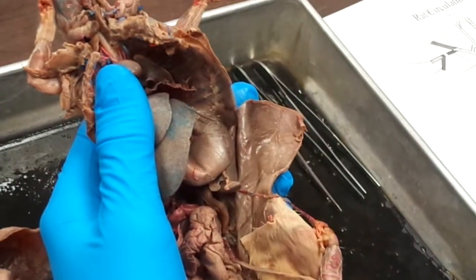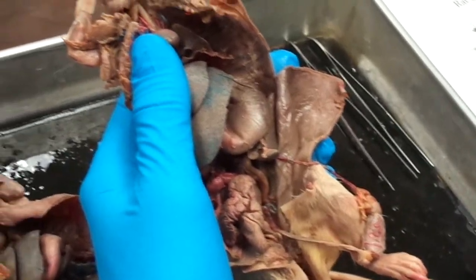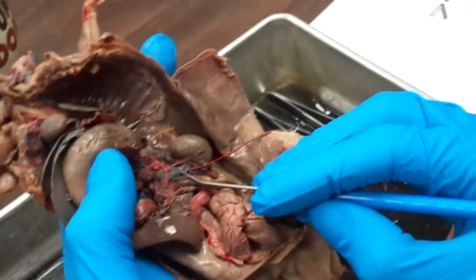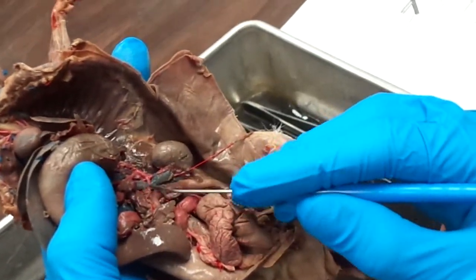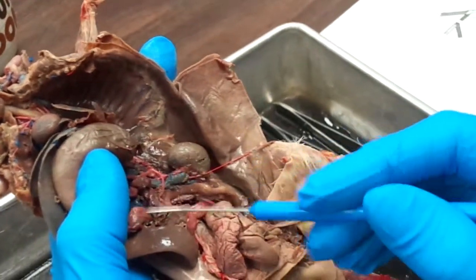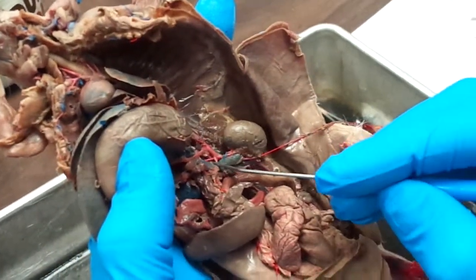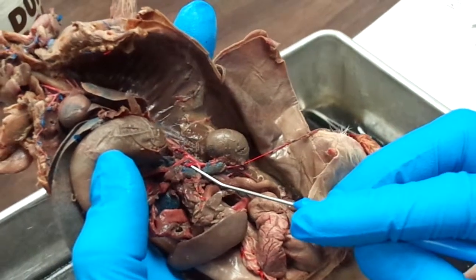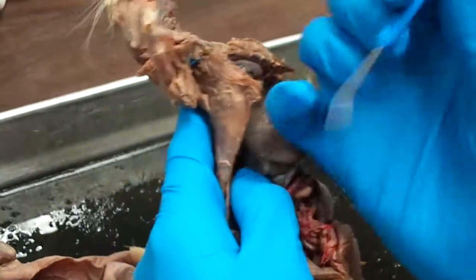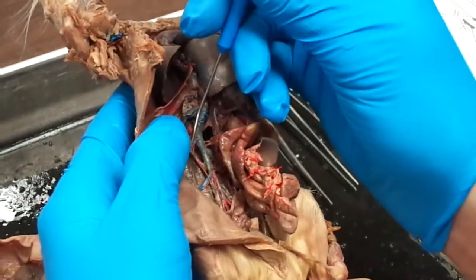Okay. So continuing down, you'll see you have your renal artery on your left side. Your right side is a little bit higher than on the left side. So your left renal artery is right here, and about equal with that is going to be your cranial mesenteric artery, which is going to the intestines and all the mesentery associated with it. So you see that. And the renal artery for the right side of the body is above that one. It's right there. You can trace it off of the center medial side of the kidney.